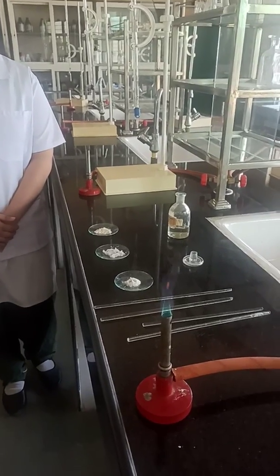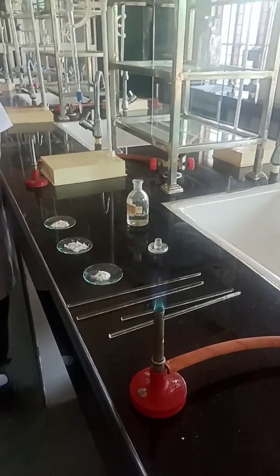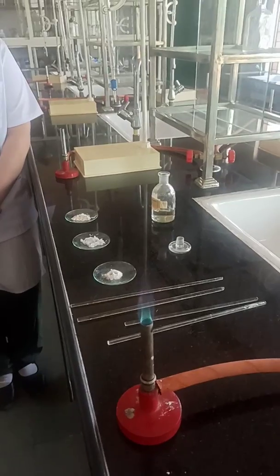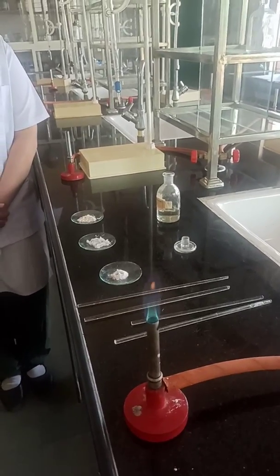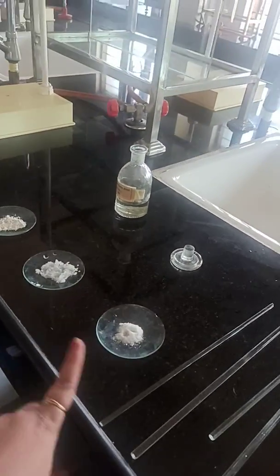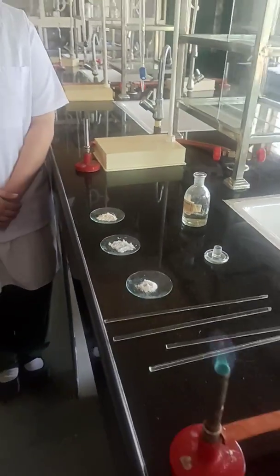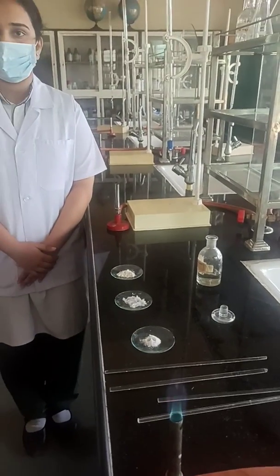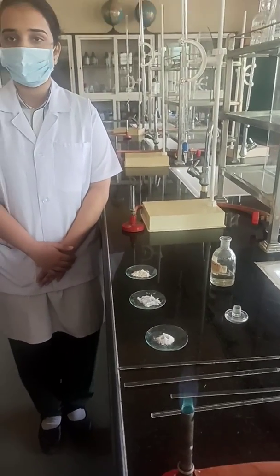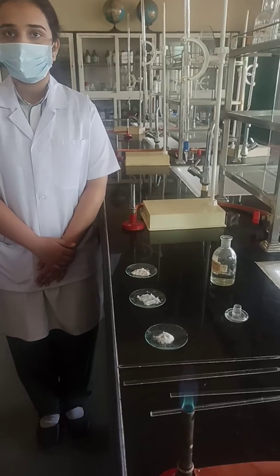Hello everyone. Today we are going to perform the flame test for Group 5 radicals. In Group 5 we have barium, strontium, and calcium. Here along with me are Asmi and Bhavishya, who are going to perform the flame test and tell which colours are imparted by these ions to the flame.